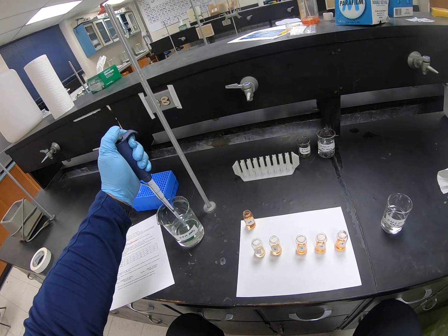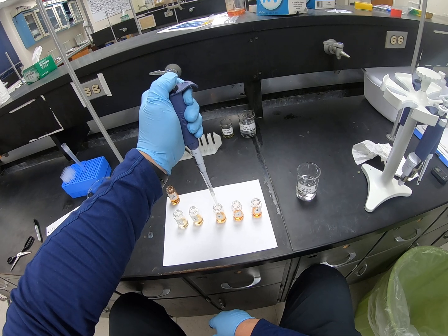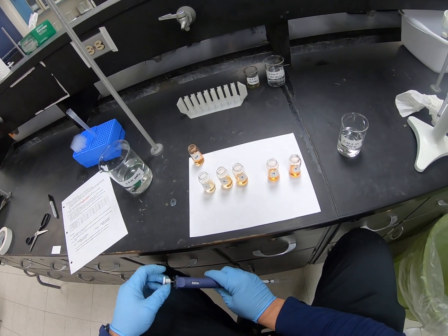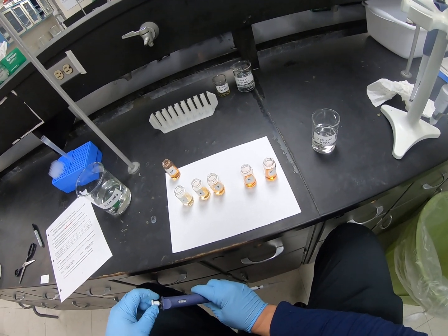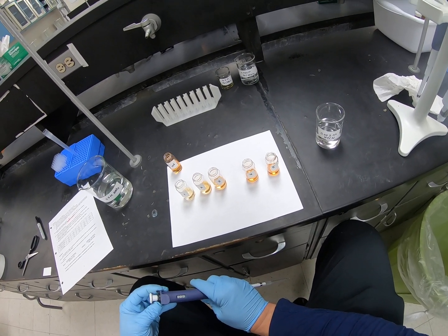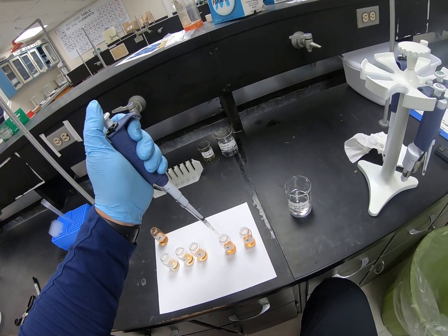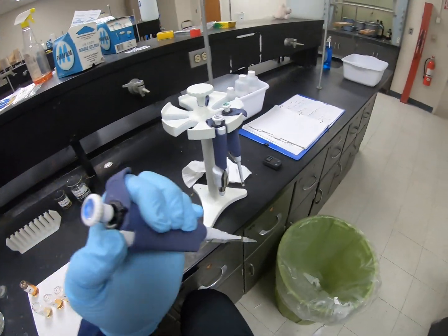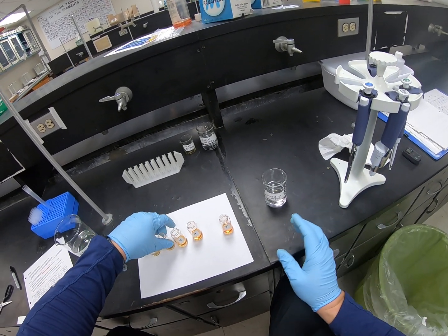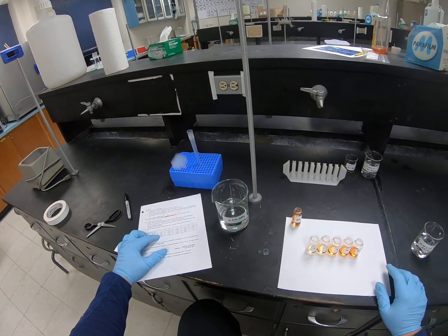So we'll dial it back into 1 ml. Number 4 needs only a 1/2 ml volume. And then number 5 doesn't need any. And kind of a check to see that if I've done these right, they all should have the same total volume in them. So they all should have a total of 5 mils.